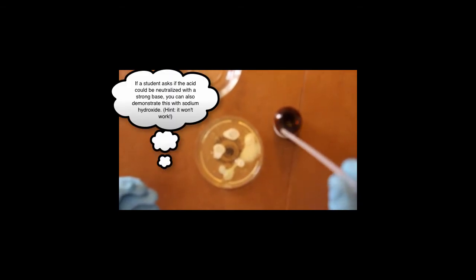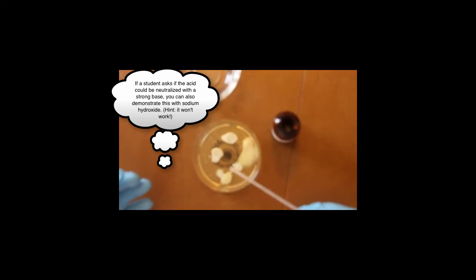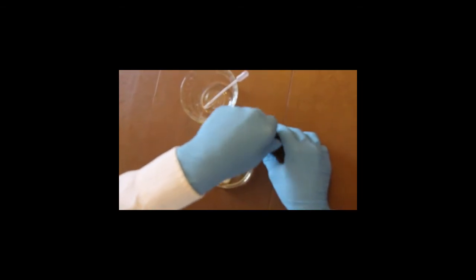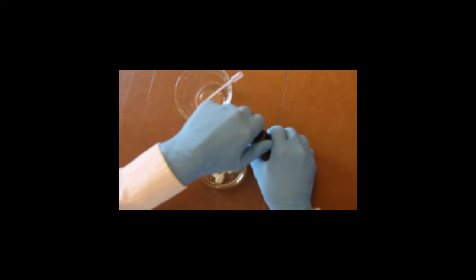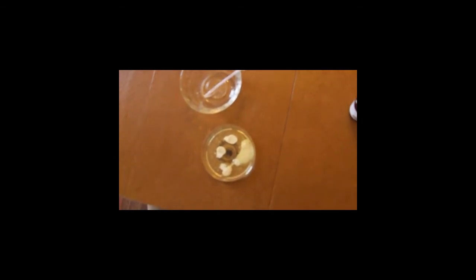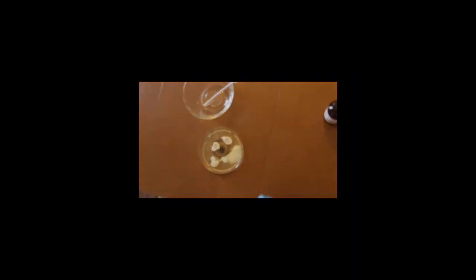Now, every good teacher will have a list of requirements when we're doing lab procedures, and this would be the live demonstration of that, and we would go back to that list to make sure that all students are doing what they're supposed to be doing. So now I'm done with my pipette. I'm simply just going to place it here in that dish that I was using and recap and tightly seal that sulfuric acid. And as you can see, we have cooked the egg, and sadly, if this was a human eye, this would be irreversible and it would be in really bad shape.